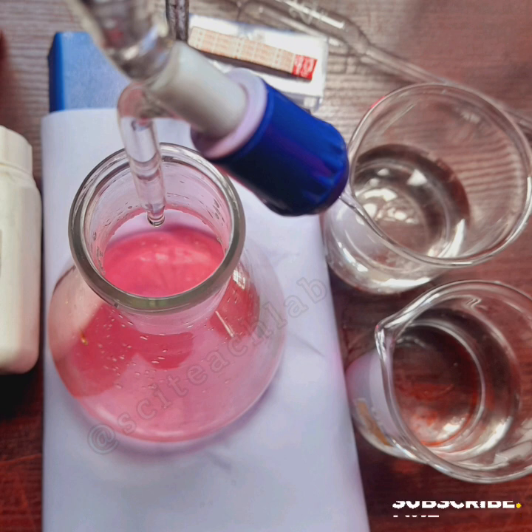Or when you are taking measurements after the titration, you just keep adding some 0.1s or from 1 and stuff like that. It will give you errors that will lead to you not having the correct range of endpoints or average titer. So make sure the meniscus, or wherever you are taking readings from, is at your eye level. Don't look at it from under, don't look at it from above. Let it be at your eye level.